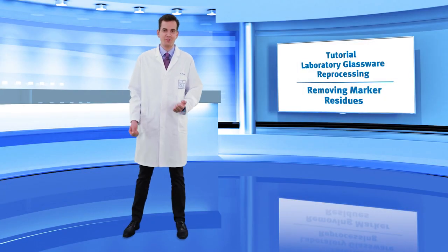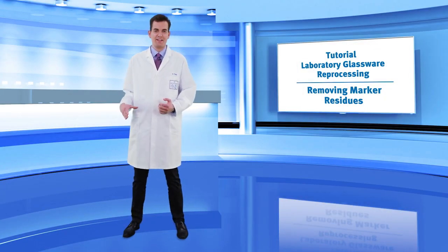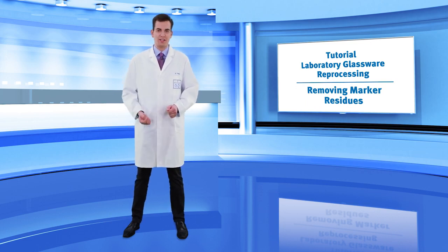Welcome to the Dr. Weigert tutorial on laboratory glassware reprocessing. Today we will show the correct way to remove marker residues.